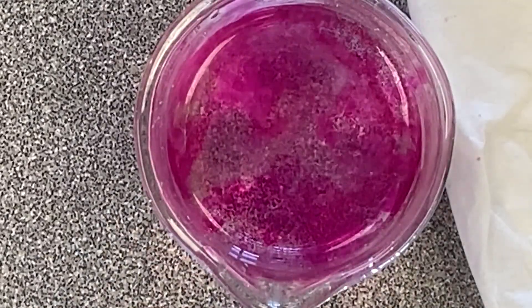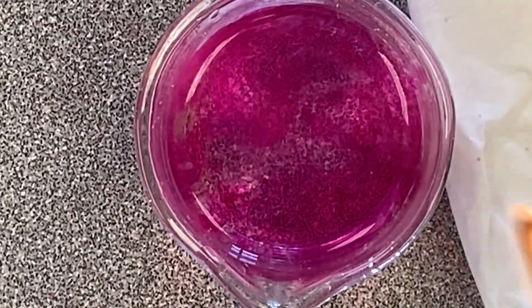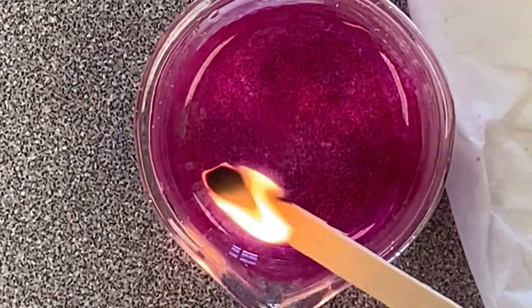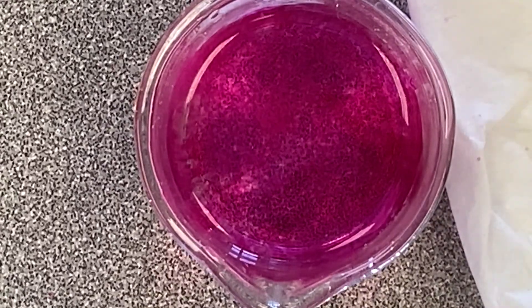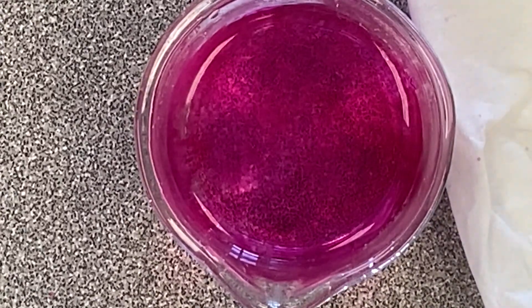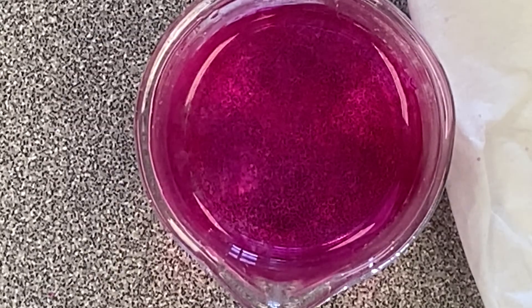It doesn't even need my flame in order to light that gas on fire. It got so hot it lit the hydrogen gas on fire all by itself.